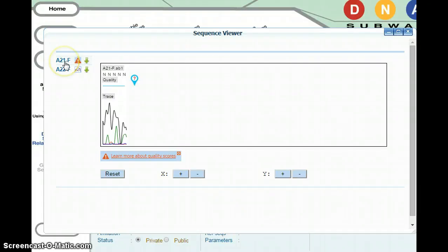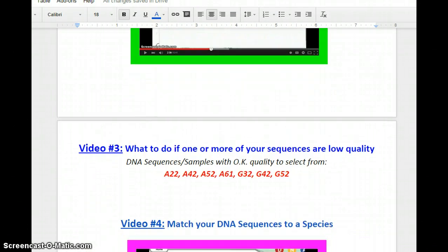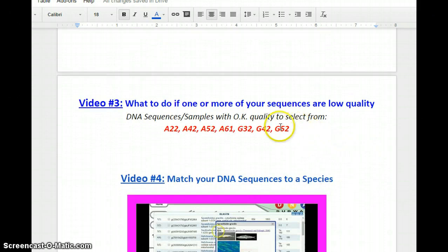If you have one sequence that is like this in your team, or you potentially even have 2 sequences that have low quality, what you need to do instead for your data analysis is to select sequences that have okay quality to choose from. Right here in your Step 7 document, I give you several DNA sequences that have good quality. A22 that we've been looking at, A42, A52, A61, and so on, all have good quality.